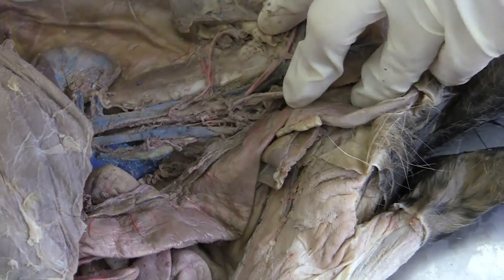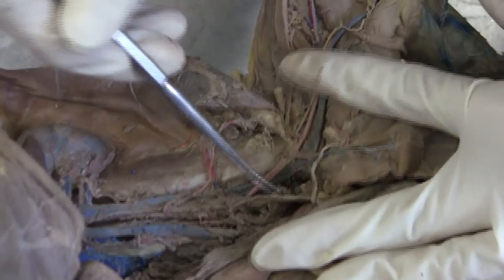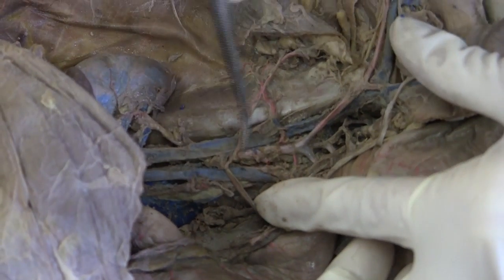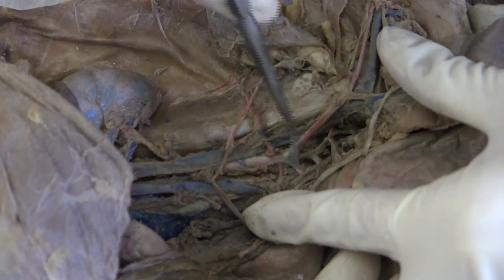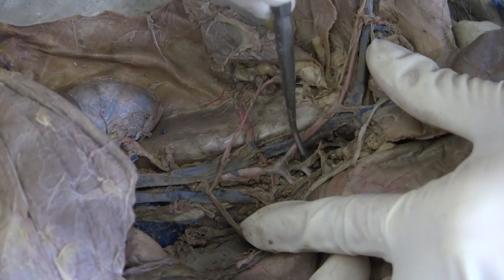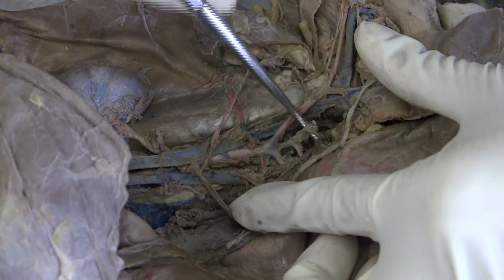The external iliac artery — so this one is a branch from the aorta. The aorta going to here. So this part, these two, is the external iliac artery. And the second branch here is the internal iliac artery.